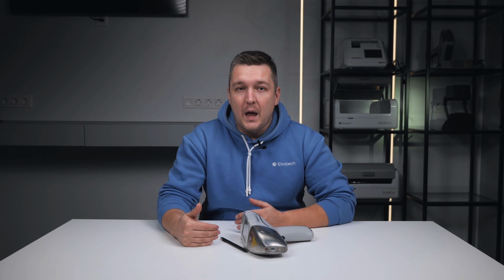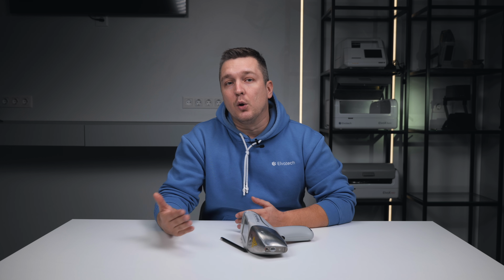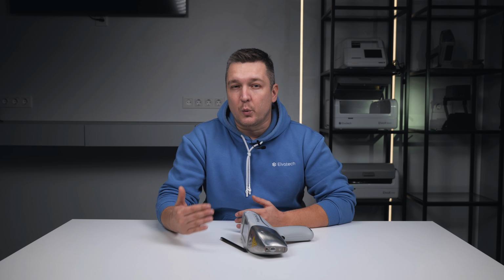First, you analyze the sample with the alloy grade to quickly understand what the alloy most likely is. And then you use compare to alloy mode to confirm in detail that the material really meets the required standard. To make both modes work as accurately as possible, there are a few important points that people often forget.